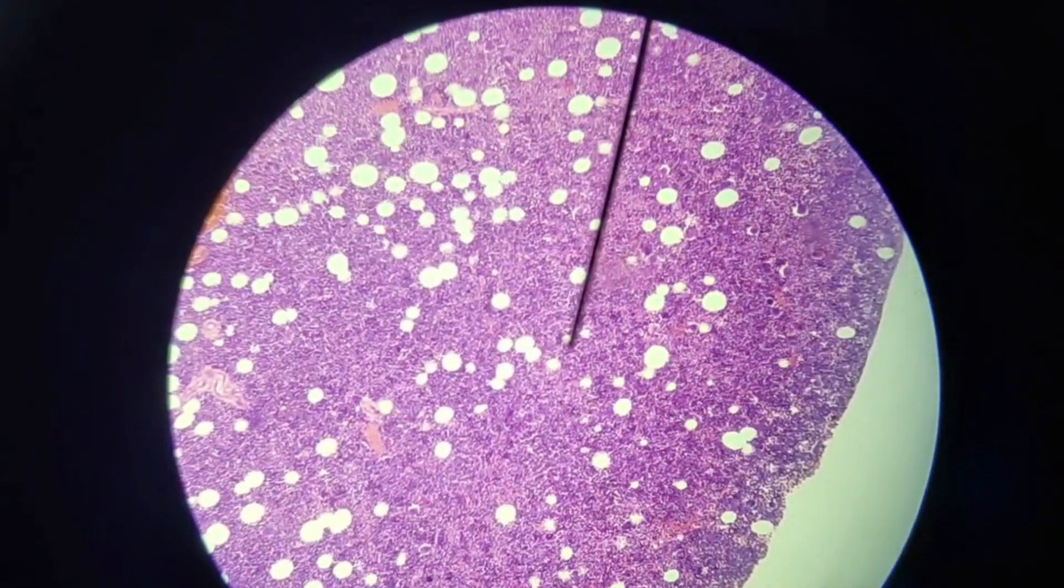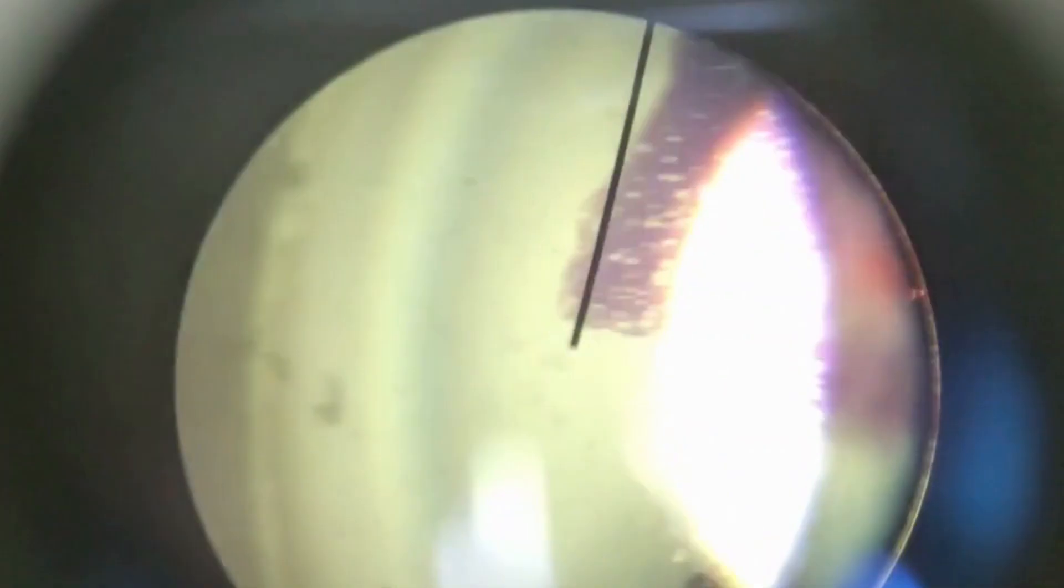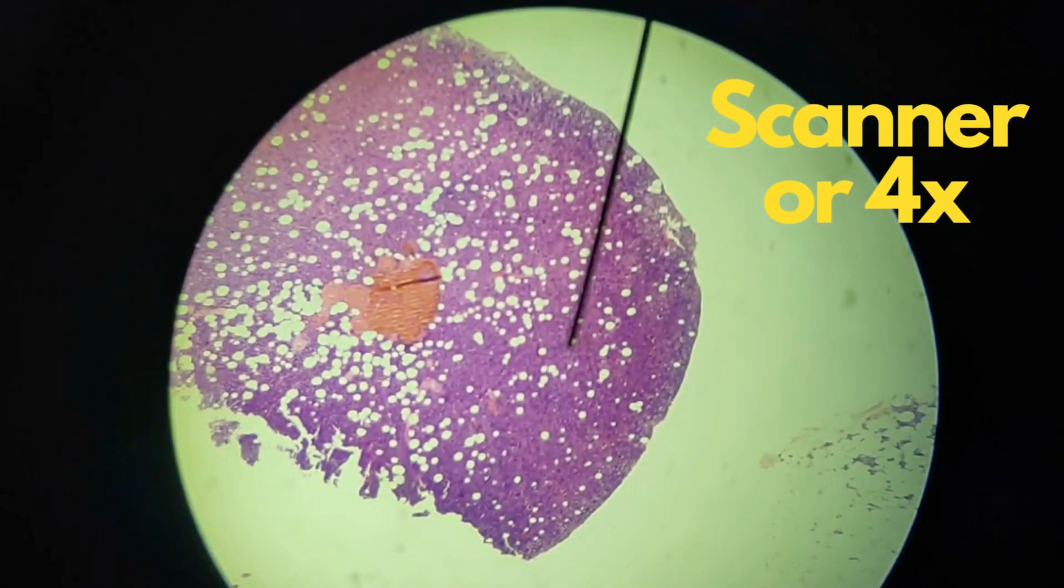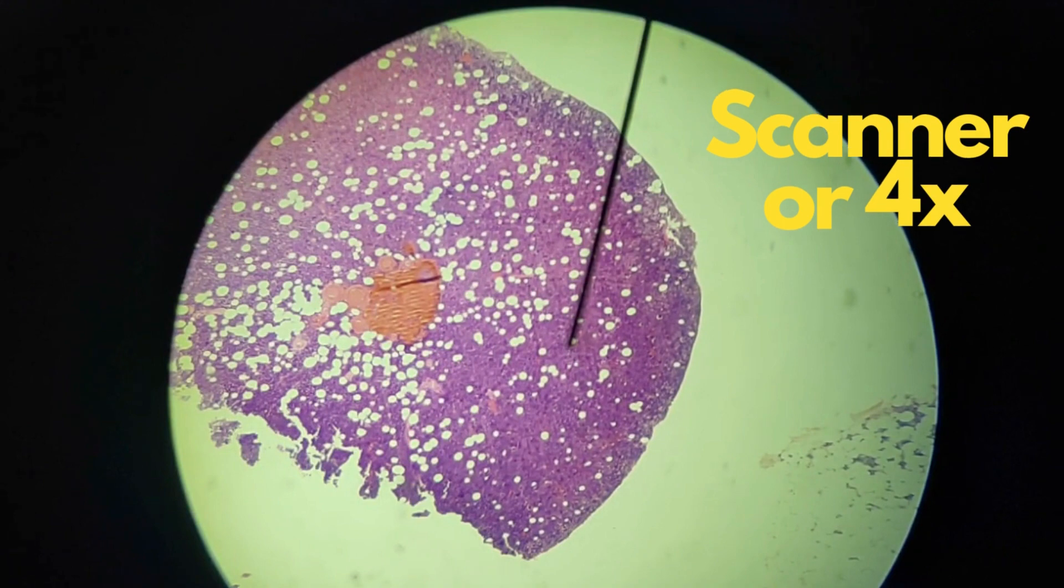I repeat, this is low power. If you want to see it at 4x or scanner, it would look like this. It is much smaller.